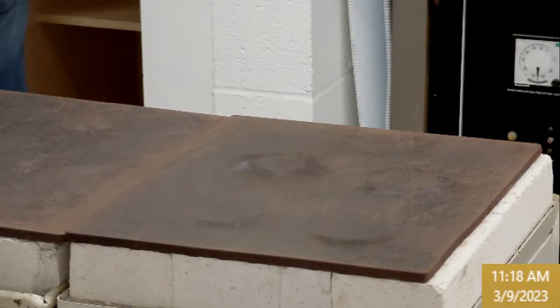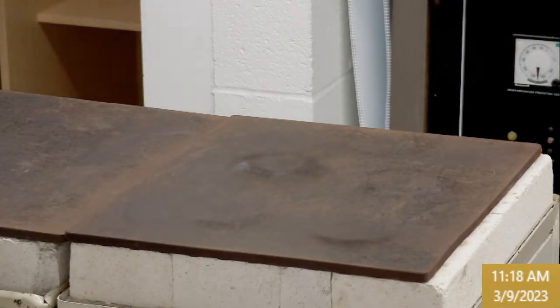These are some cool looking crystals. Yeah. Those emeralds? But then again, I don't know if I have it out right now, but I have a beaker of razor blades, and I had a student once say, Dr. Ray, there's got to be a better way than having us dig razor blades out of a beaker. What could possibly go wrong digging razor blades out of a beaker? Yeah, I know, we just have lots of beakers. It's easy to store in. I'm sorry. Be careful.